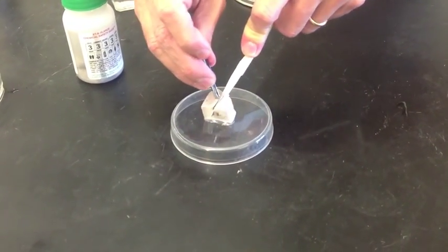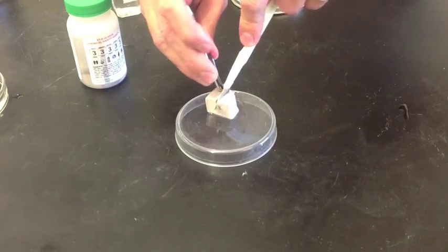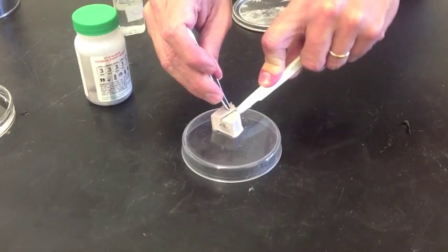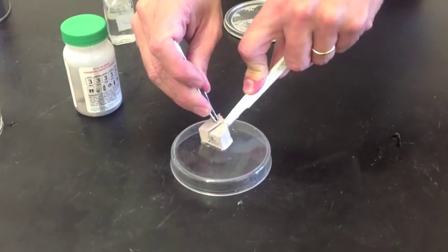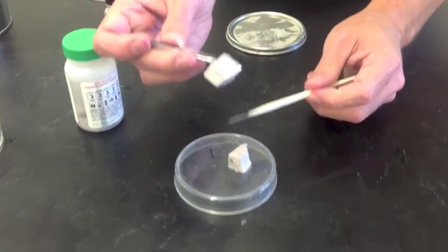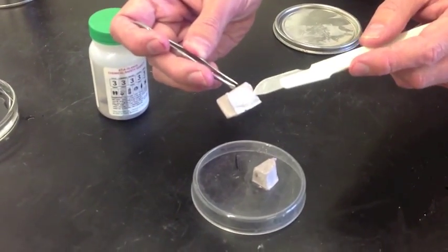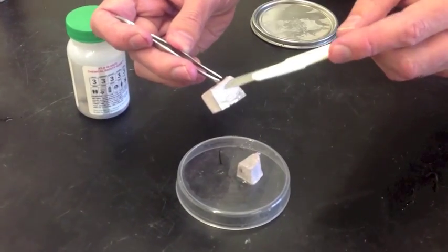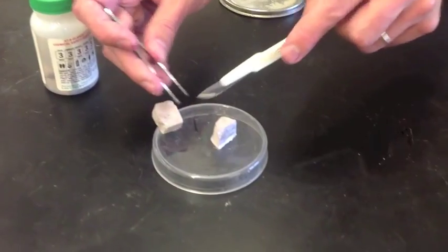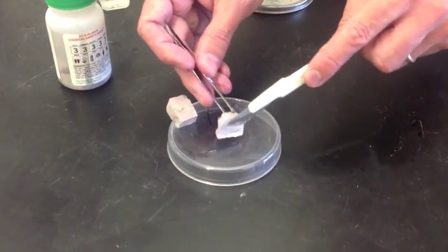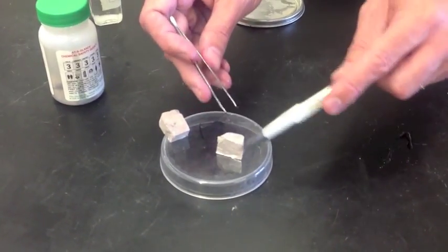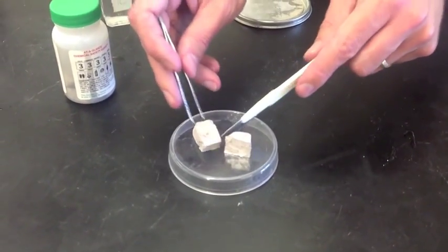I'll get my tweezers here to help me out. We're using a plate that's plastic, so hopefully I'm not pressing too hard. And as you can see, there is a lot of shininess and luster when you cut it open. And you'll see the same thing on this one as well. Can you see that? So that's what makes it a metal.